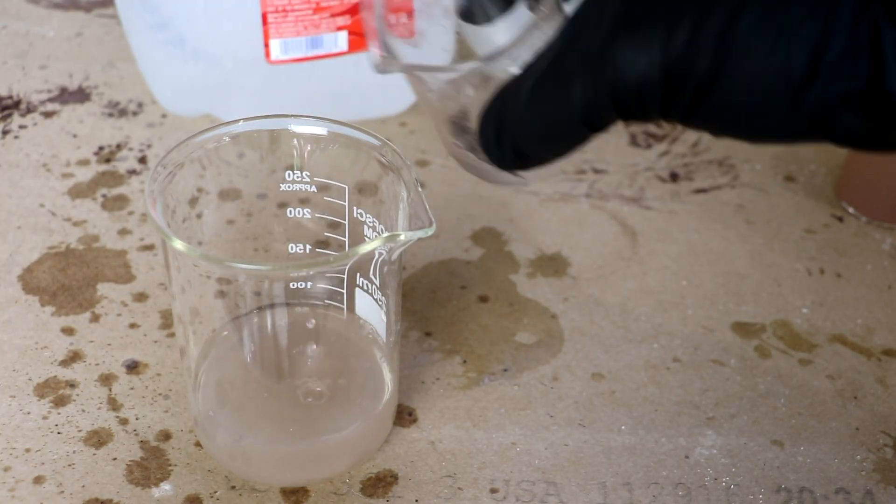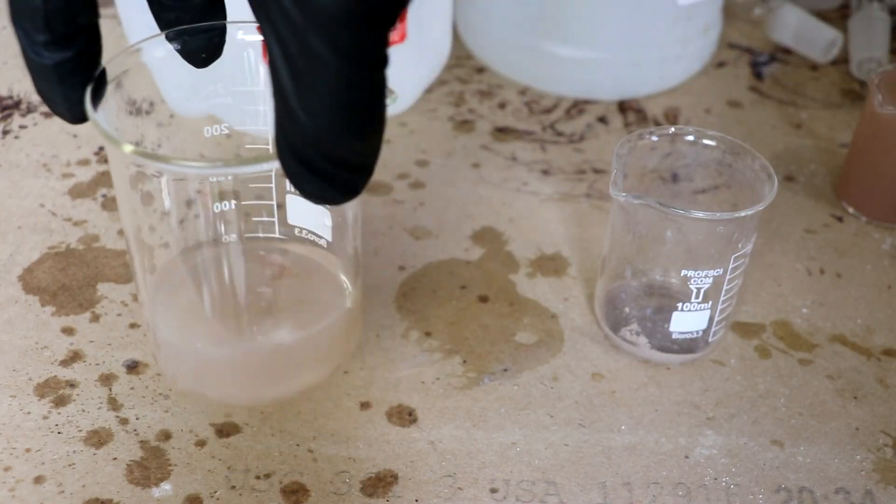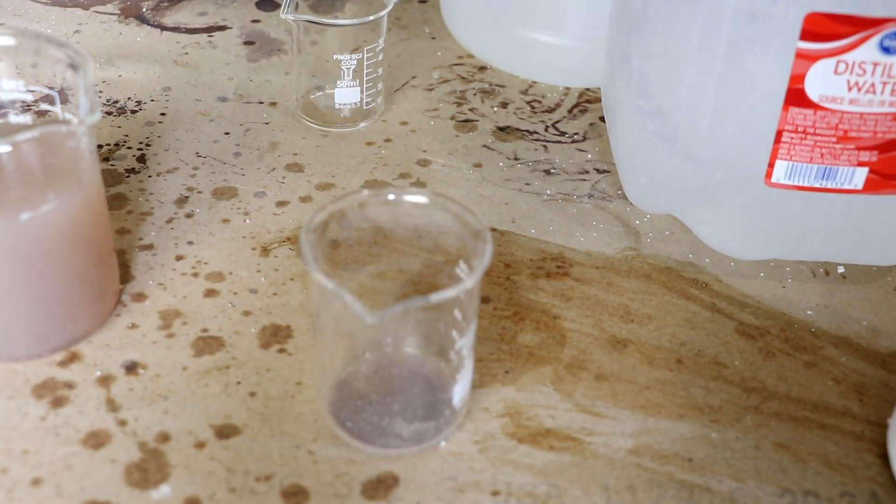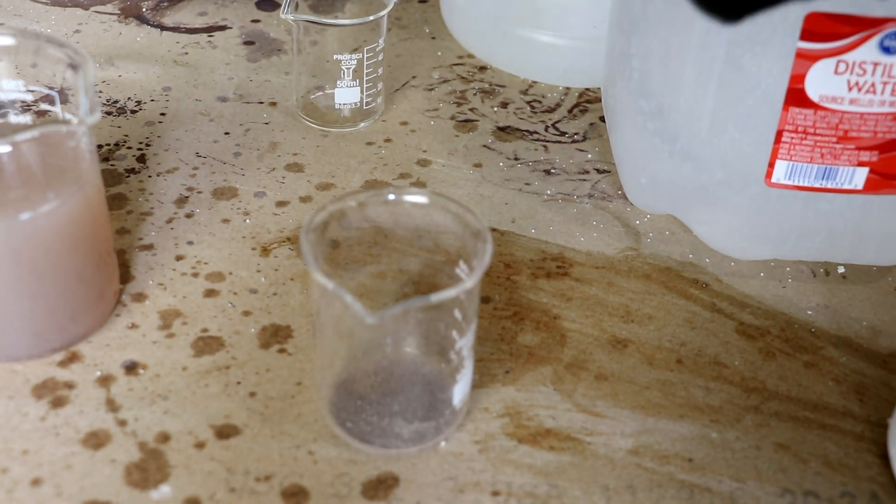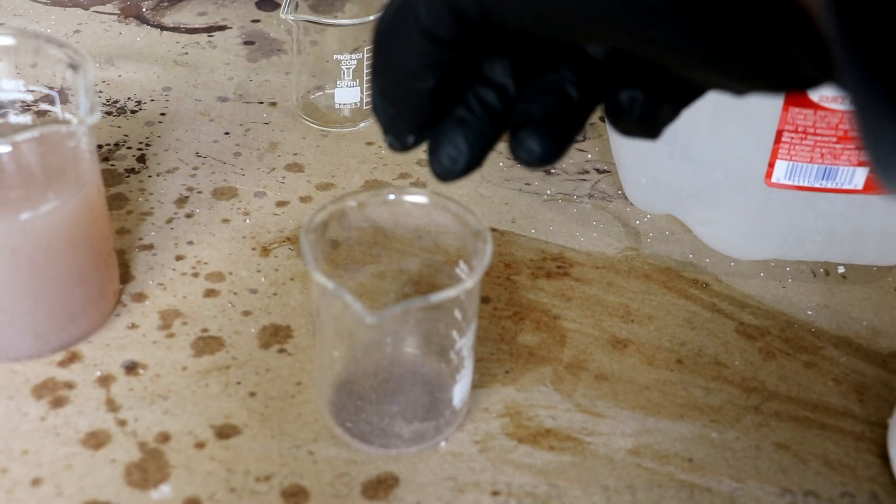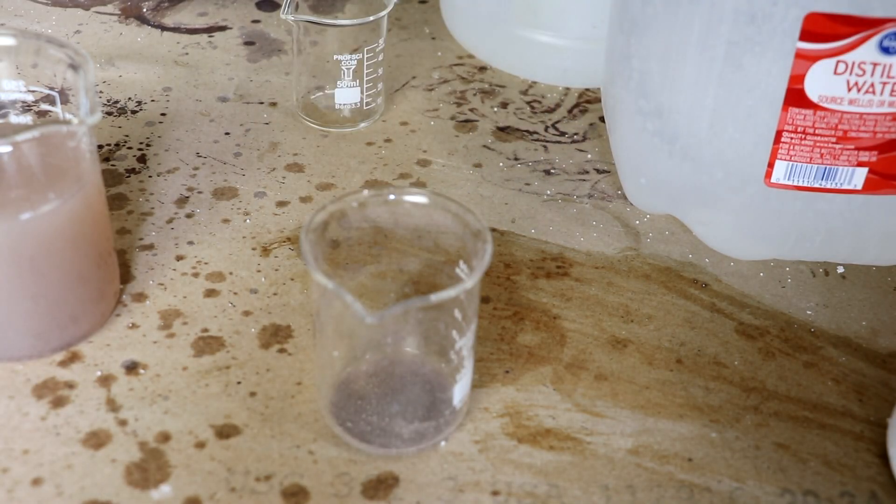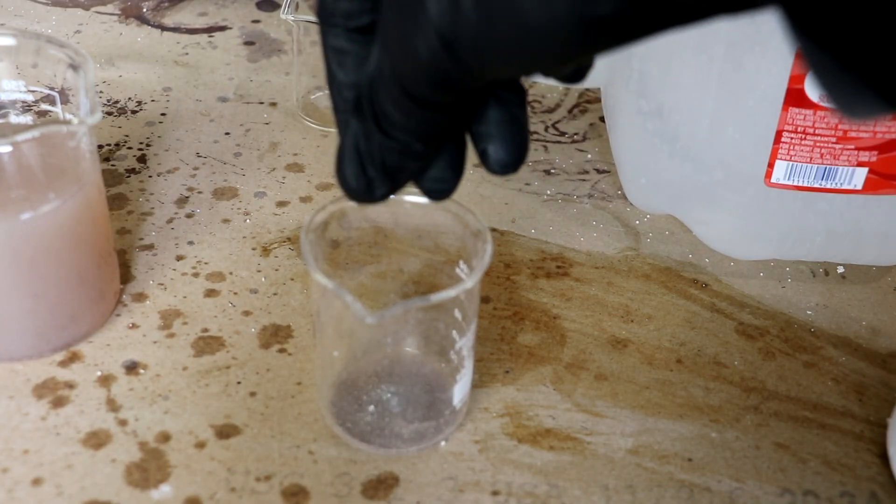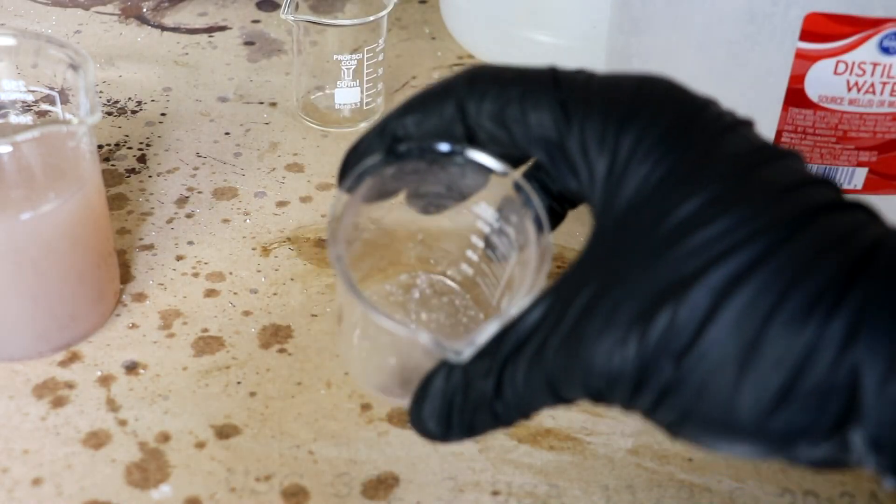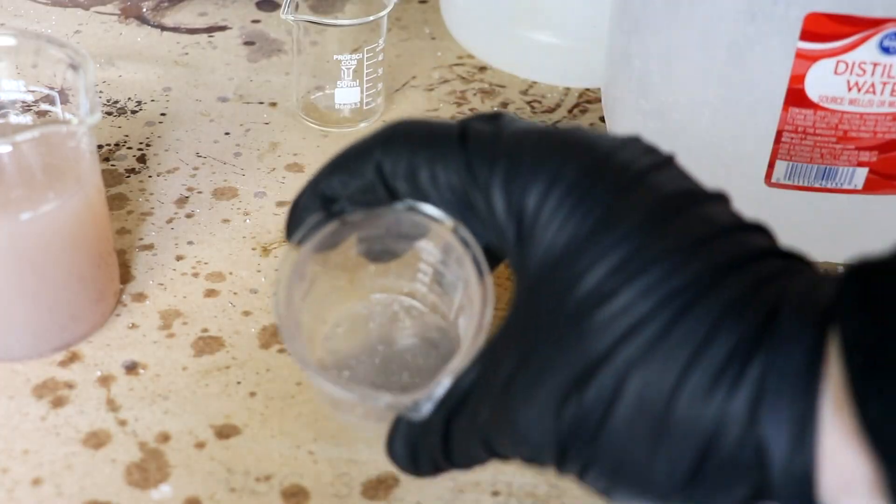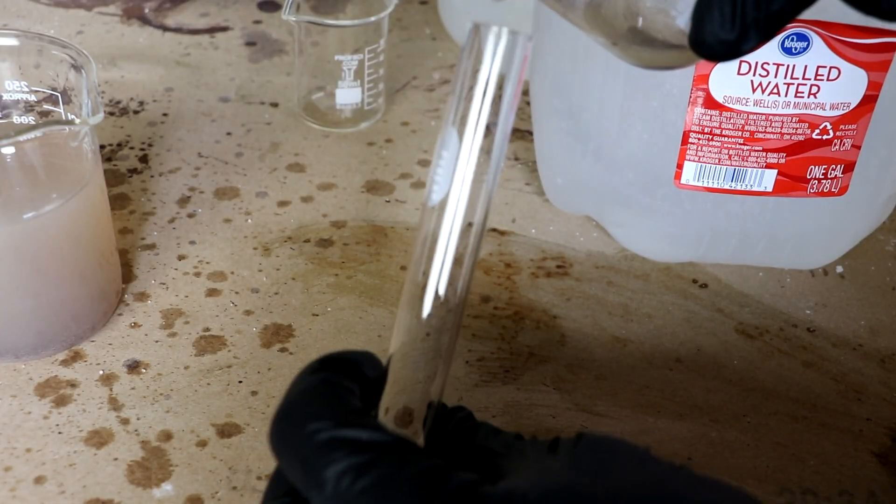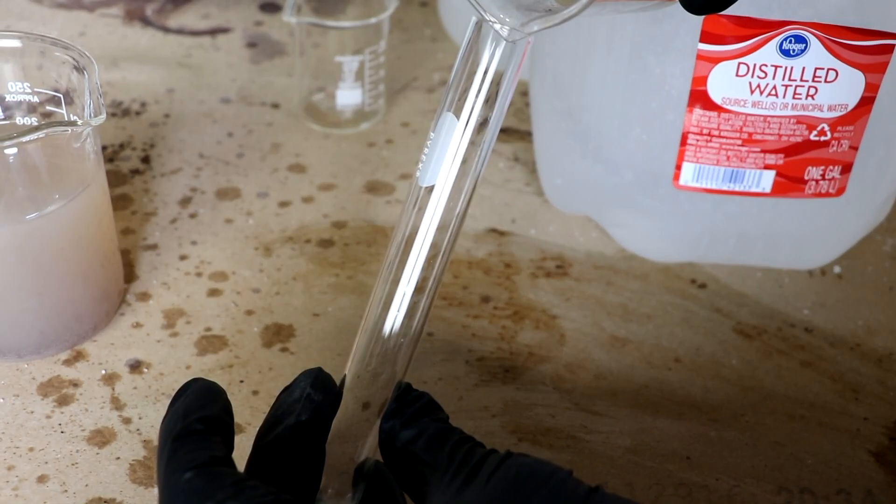I will lose some iodine doing this, but I'll save the wash water. Now that I've got it washed pretty well, I'm going to convert the silver iodide back into sodium iodide by adding a little bit of sodium hydroxide here. The silver will form silver oxide and of course I'll end up with a little bit of sodium iodide. So now I should have a solution of sodium iodide in water. So I'm going to decant this into a test tube.